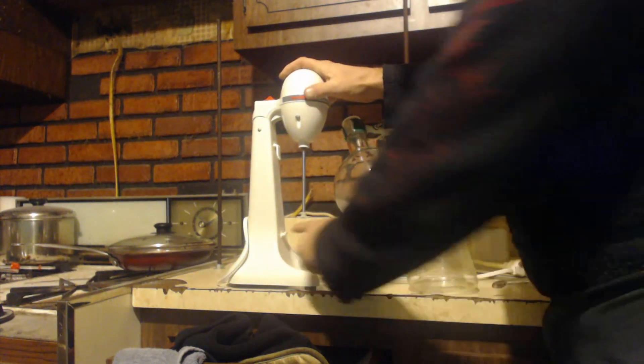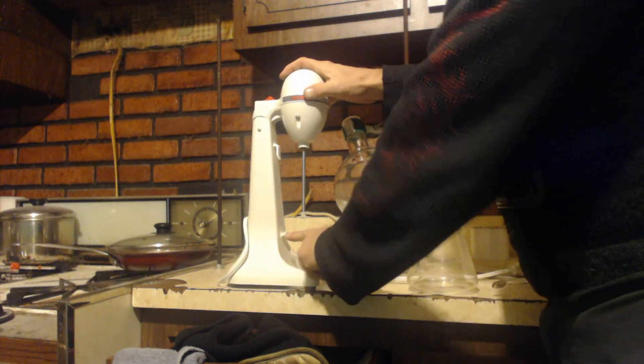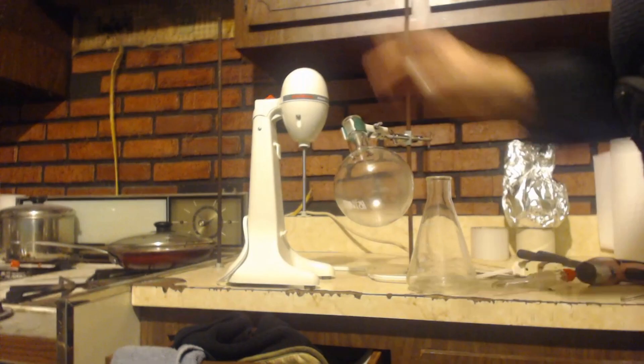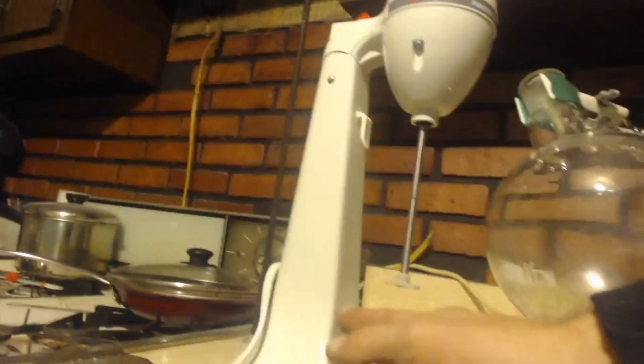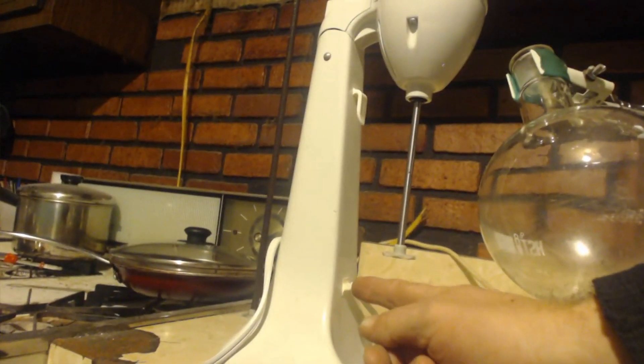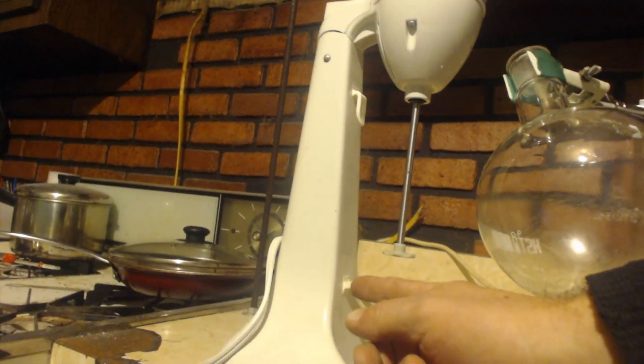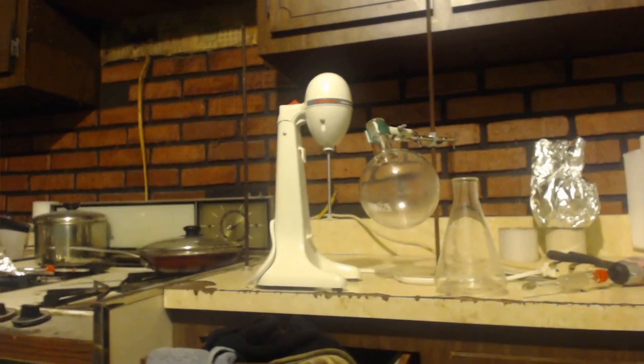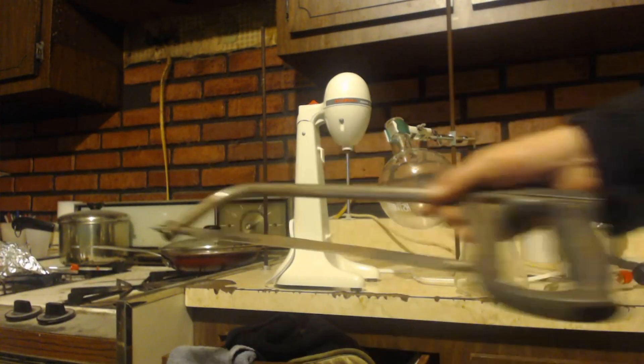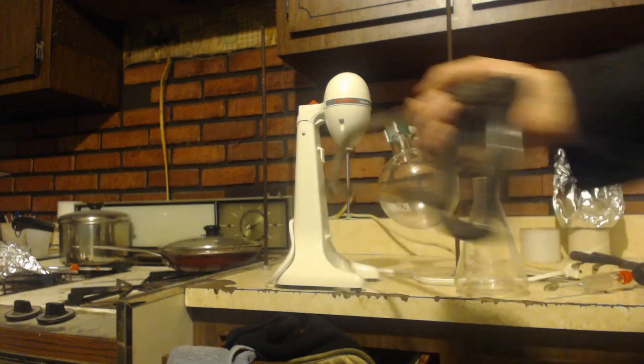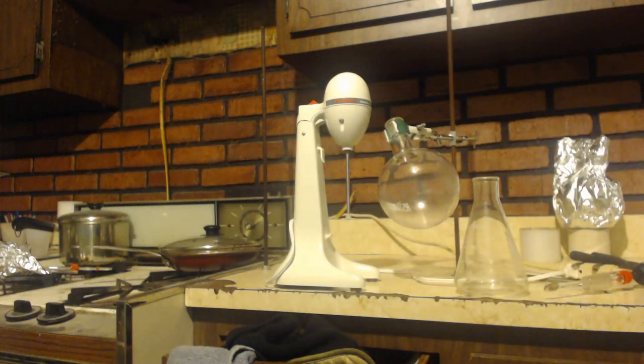Now if you can put this on here, there's a little plastic thing I guess you're supposed to hang your cup on it to hold it in place. You can cut that off with a hacksaw so that you can move your Erlenmeyer flask over more.